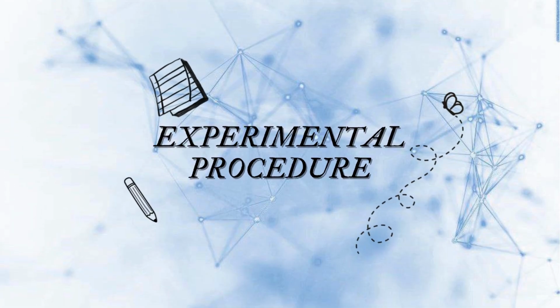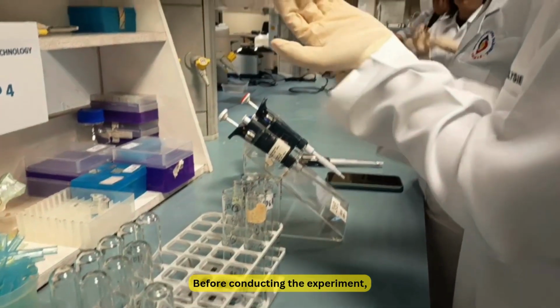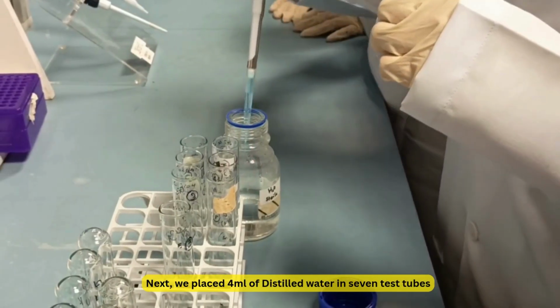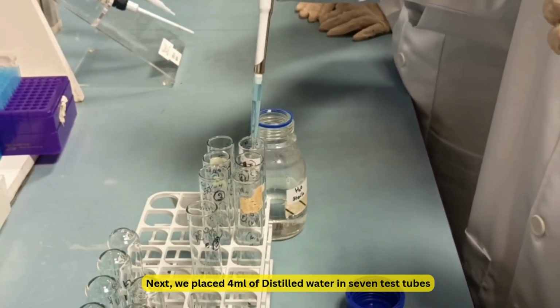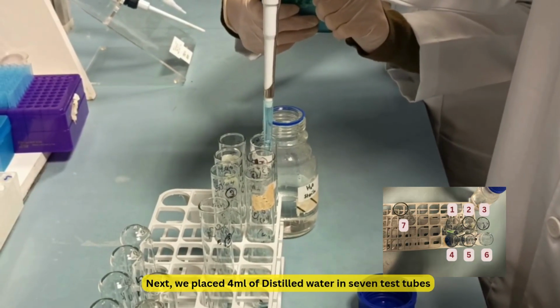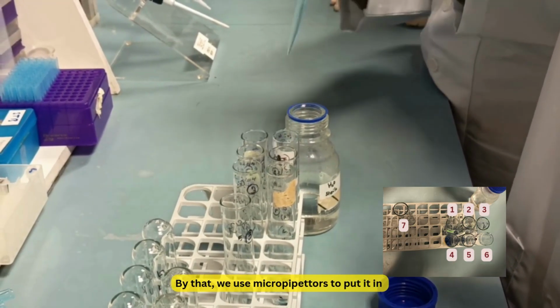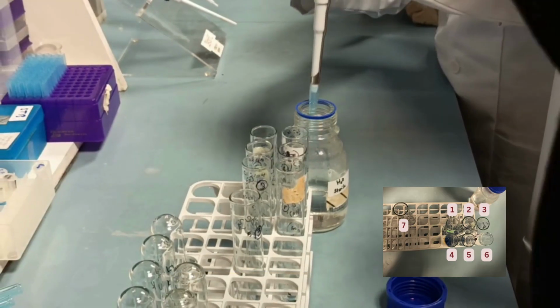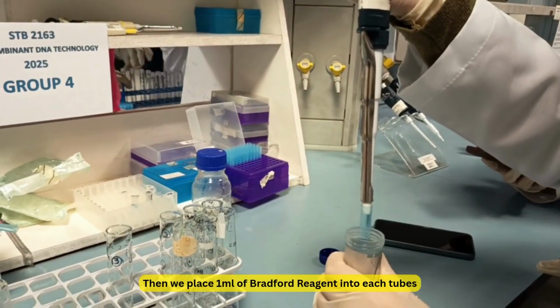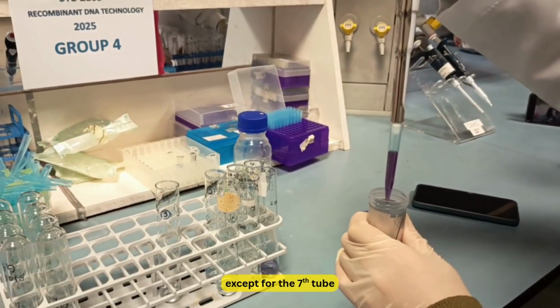Our experimental procedure is: before conducting the experiment, we were asked to wear gloves for safety purposes. Next, we place 4 ml of distilled water in 7 test tubes. By that, we use micropipettes to put it in. Then, we place 1 ml of Bradford reagent into each tube except for the 7th tube.